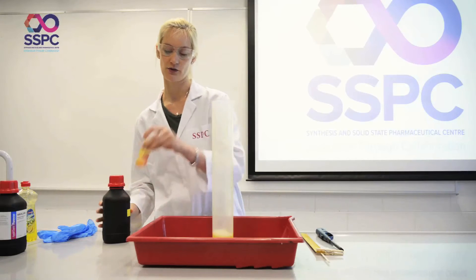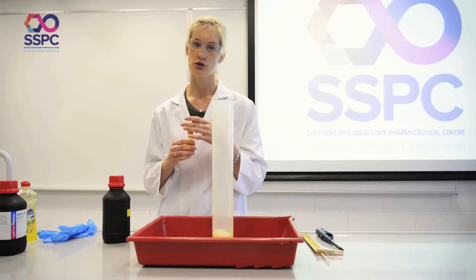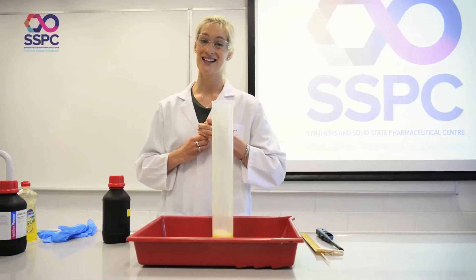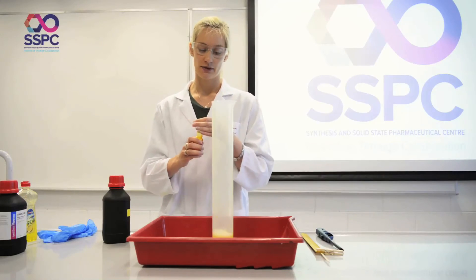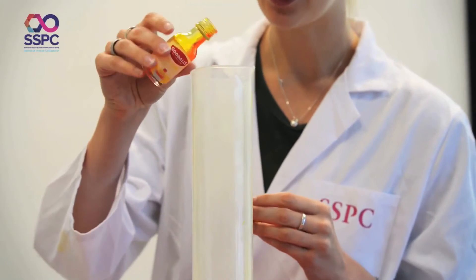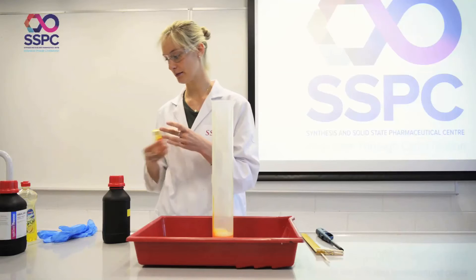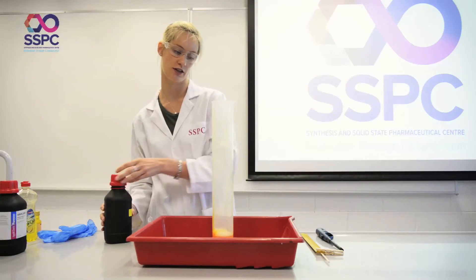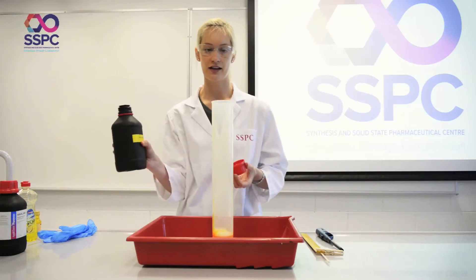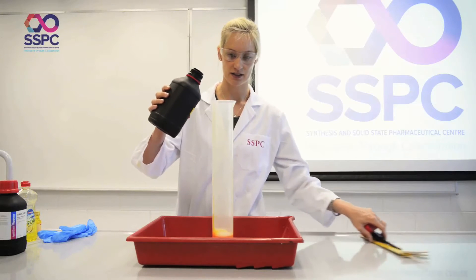If you want to, you can also use food colouring — you don't have to, it just colours the suds that come out and makes it a bit more visual for children in the classroom. And then finally I'll put in my potassium iodide.